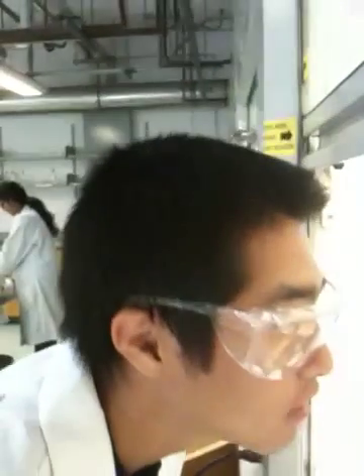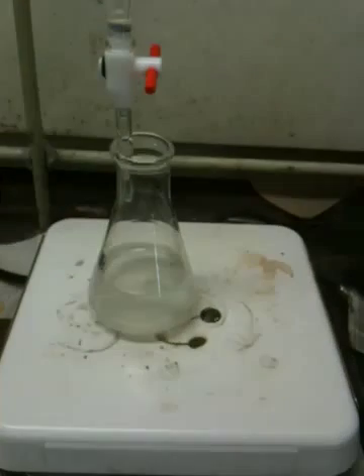Very good titration this time. Props to you. Props to you, Daisuke. Props to you. You're welcome. Here's mine — I'm already done.